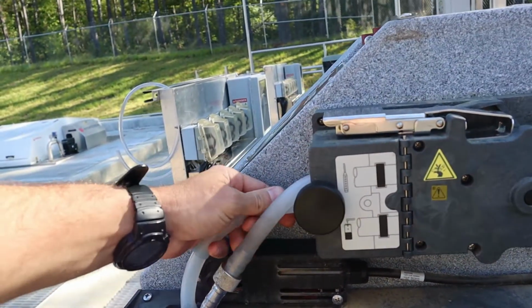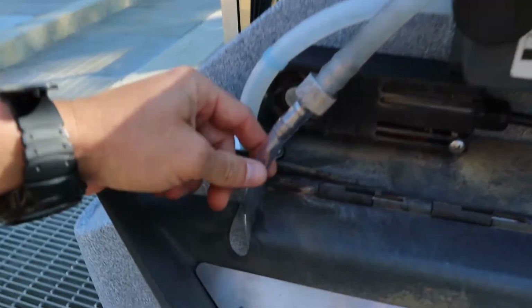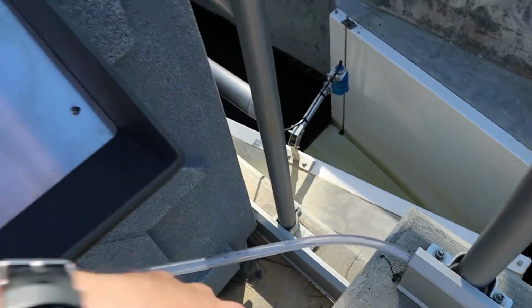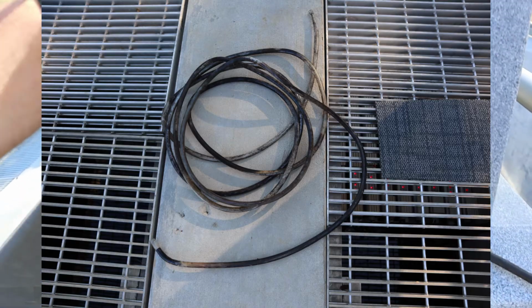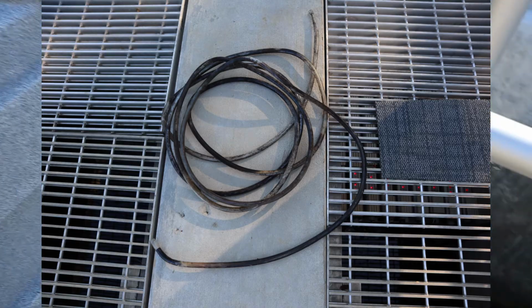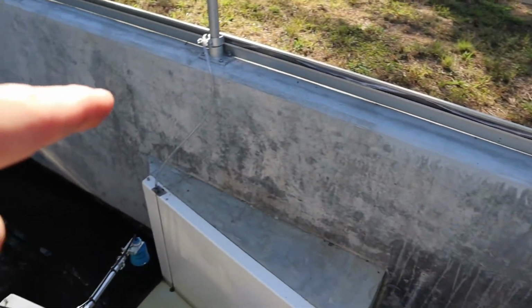We've had issues where if your hose ever busts, you have to replace the hose. Sometimes if this hose right here gets really dirty, this is a brand new one, I've just replaced it recently. I'll throw a picture up of the old one. It was pretty gross, but that comes into play and is very important because you don't ever want to shoot yourself in the foot.